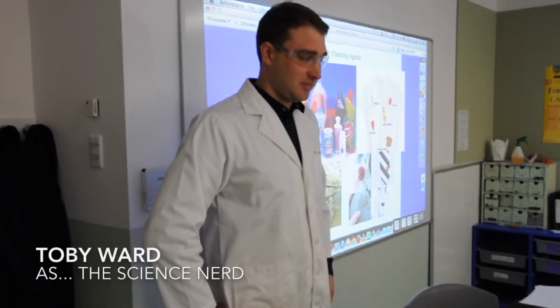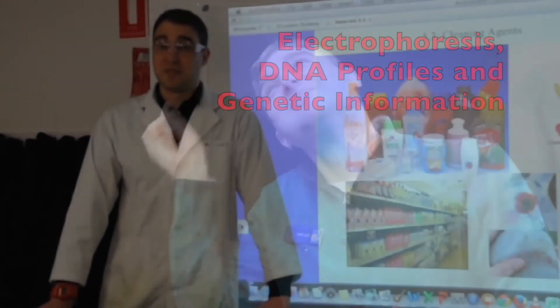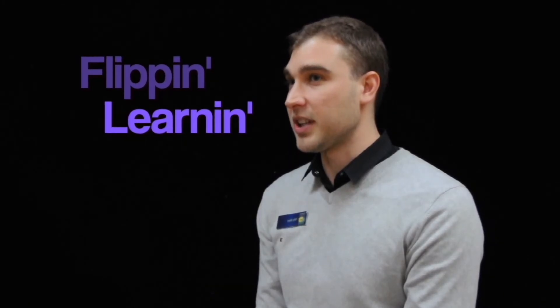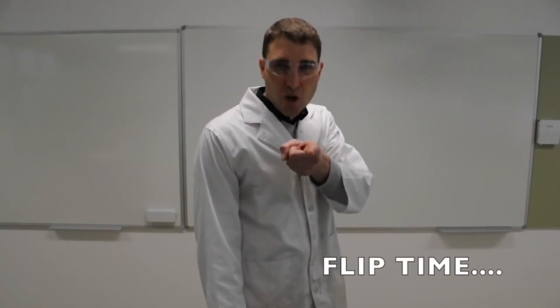One, gather your samples. Two, put some dye in those samples. Three, position the gel so the samples don't run the wrong way. Four, don't forget your buffer. Five, don't forget your ladder. Six, don't forget your controls and connect that old gel to a power source.